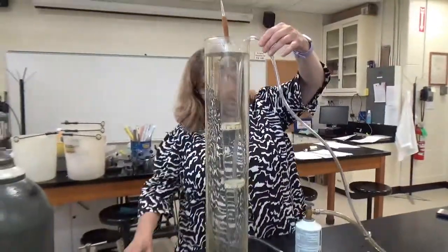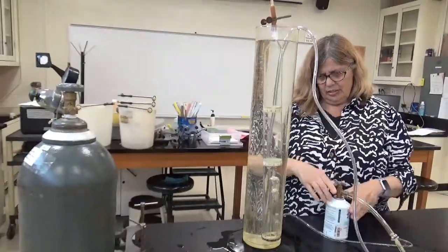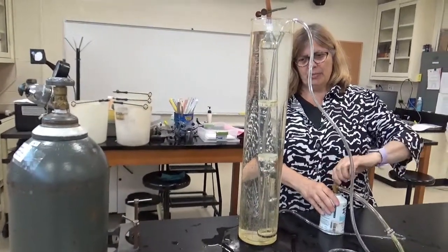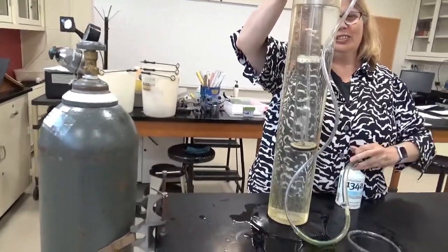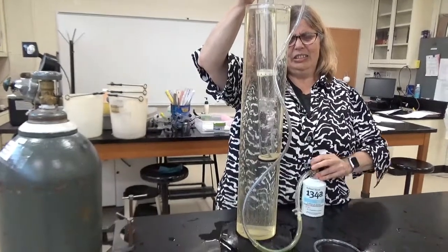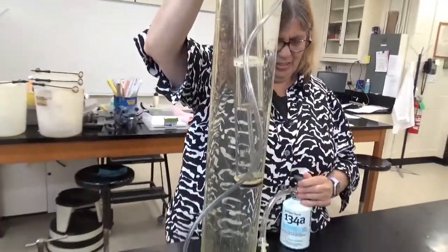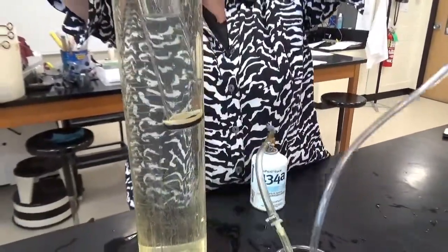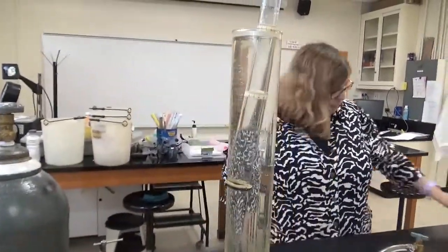Hooked in. I gotta get this closed. So this is the stuff that allows air conditioners to do what they do. Takes a while to fill this one if I remember right. Oh, there it is. Oh, there we go. So when you look at the molar mass of this particular gas, you'll notice it's different from the others, quite different. We got plenty in here. All right, I'm going to take this out, and I'm going to just tighten this all the way. Yeah, good idea. Get my cell phone ready.